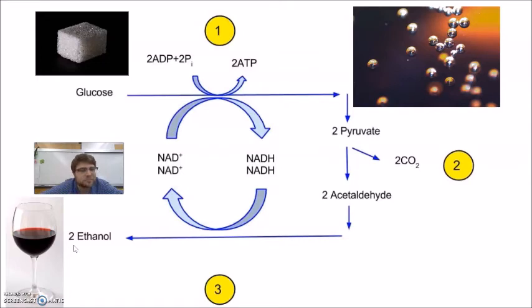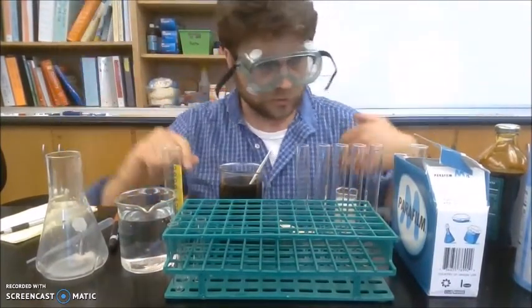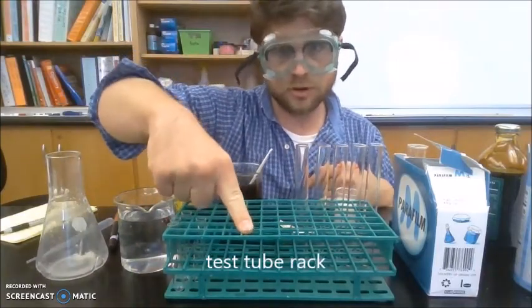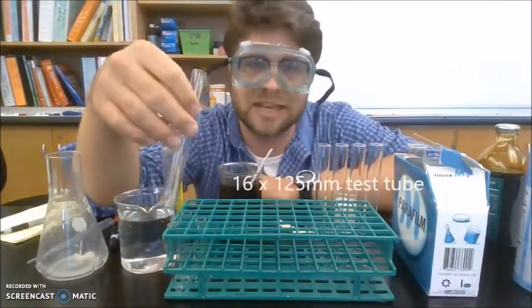So, sorry. Hey, class. So right now we are going to set up our yeast lab. I have all my materials out in front of me. So first, I have this green test tube rack to hold my test tubes. I have 5 16 by 125 test tubes.